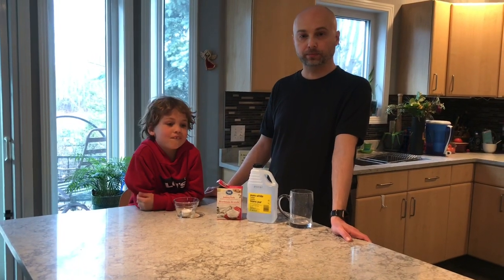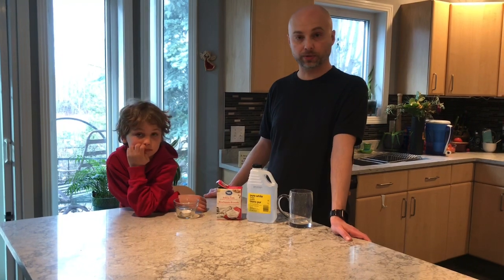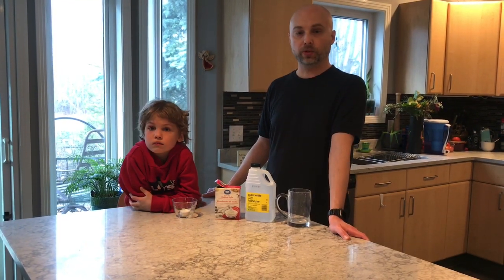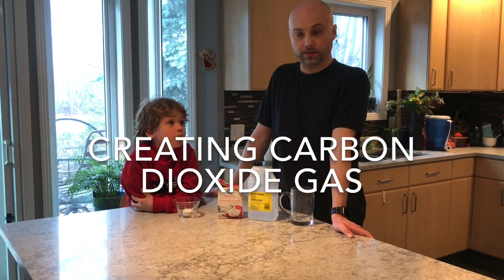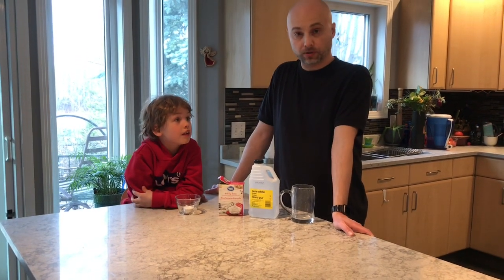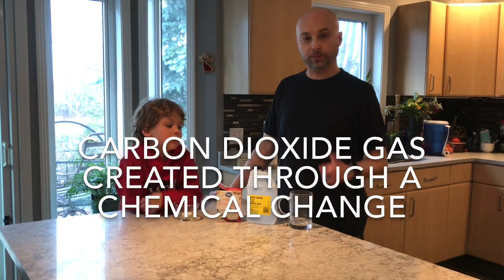Hello once again, Mr. W and Professor Marcus here with you to do another classroom chemistry experiment. And this one we are going to create carbon dioxide gas using two different methods. One will be through a physical change and one will be through a chemical change. We're going to start with the chemical change.